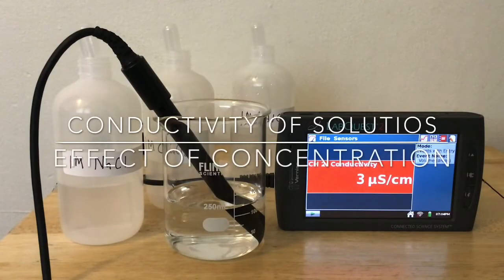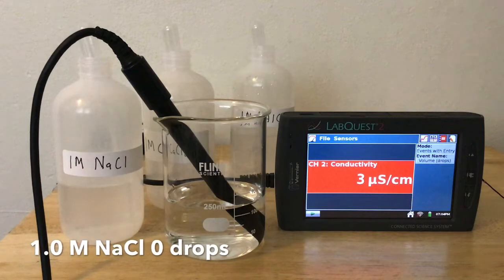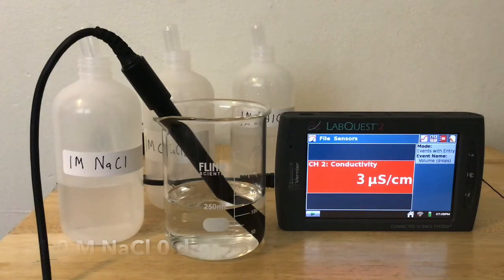The Conductivity of Solutions Lab that we are going to do today involves using three solutions: 1 molar sodium chloride, 1 molar calcium chloride, and 1 molar aluminum chloride, a conductivity probe, and our LabQuest. So we're going to start off with our sodium chloride, and we're going to add drops of it to the water, stir it, and then read what the conductivity probe is telling us.